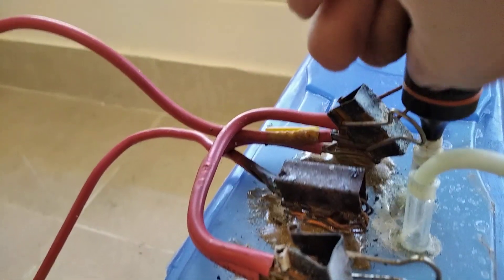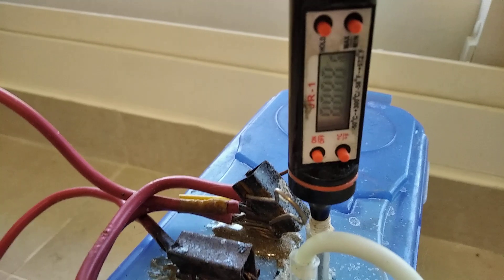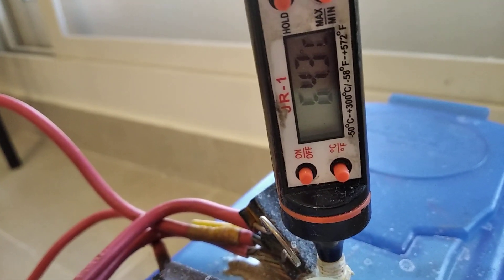And the temperature measurement of this thing is 64.3 degrees Celsius which is well within the operating temperature range of 60 to 70 degrees.